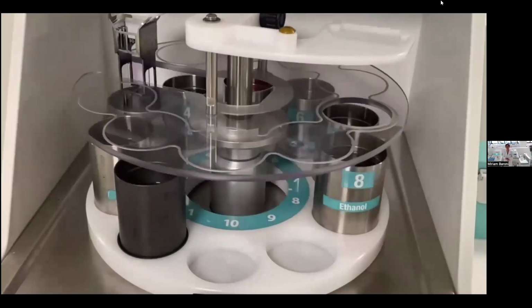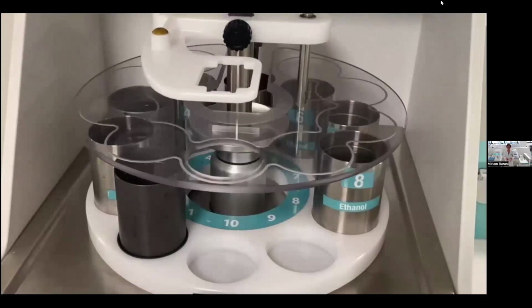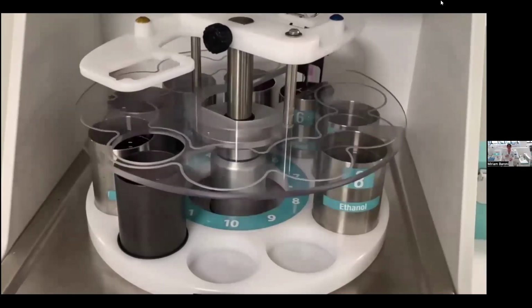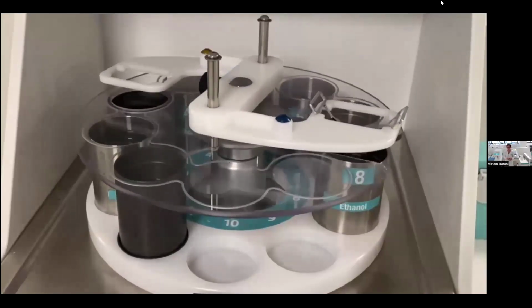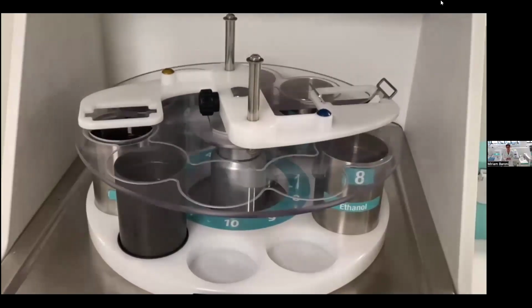After the processing step, the staining is automatic, freeing the technician to perform other tasks, and it is standardized. So the result is always the same, and it's not operator dependent. The Presto Pro allows to create different protocols in order to have the perfect balance between hematoxylin and eosin for each different tissue type. The combination of the technician's expertise and the automation of the Presto Pro gives the best result. In addition, Presto Pro controls the life of the reagent in order to never have a faint result.